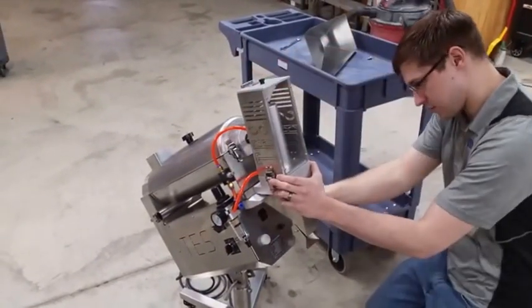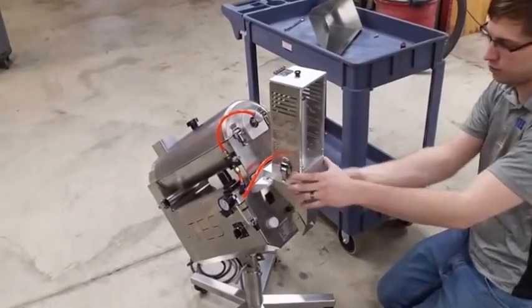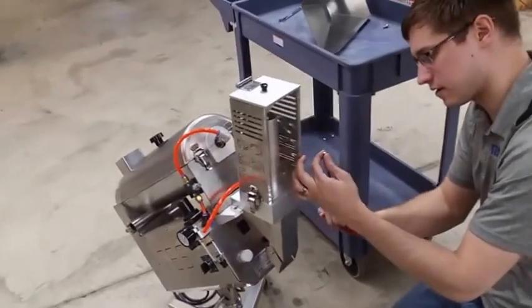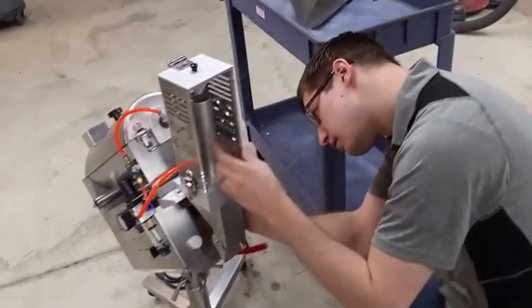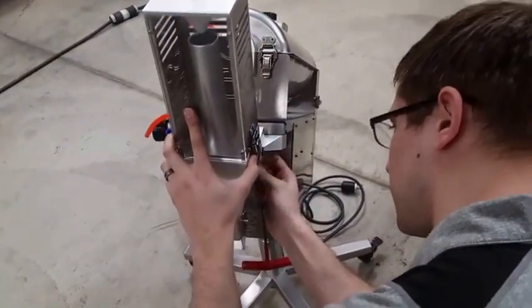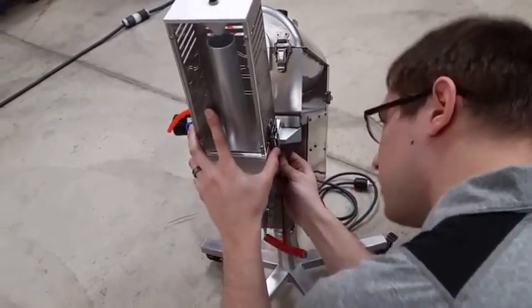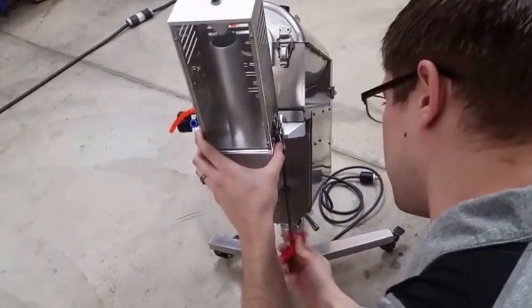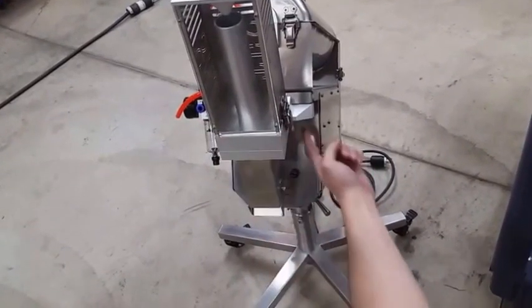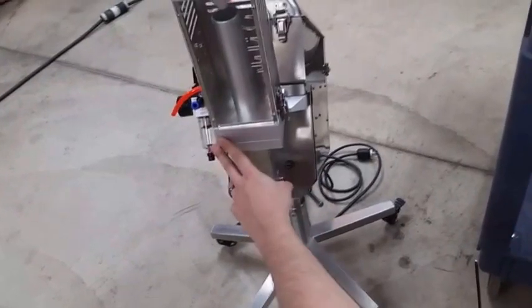That just goes in there and then it will rest on the top of these brackets. You're going to want to get your Allen wrench to number five. Once you get both sides in, you can then tighten up the back bolts so that they don't rotate. And then it will rest just like that.